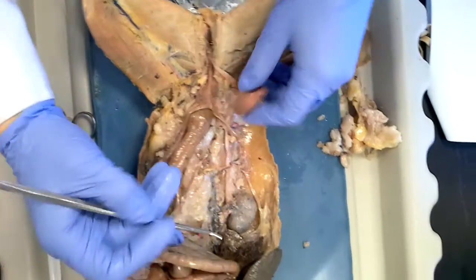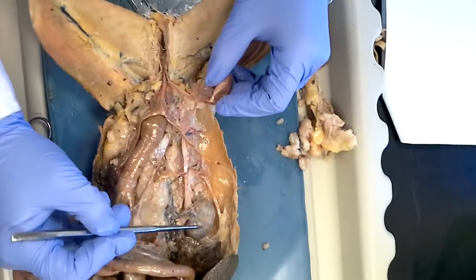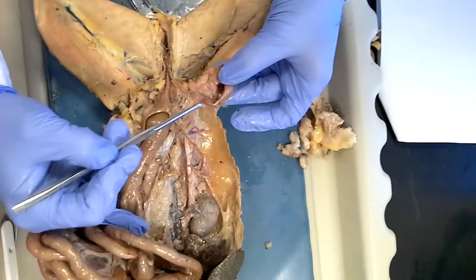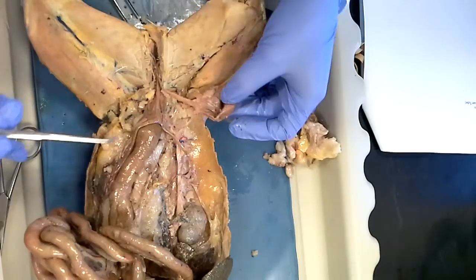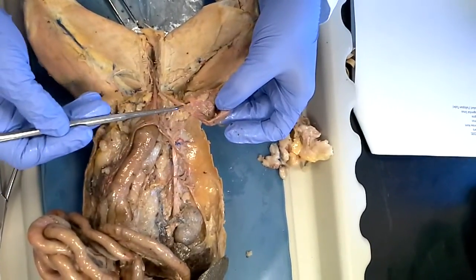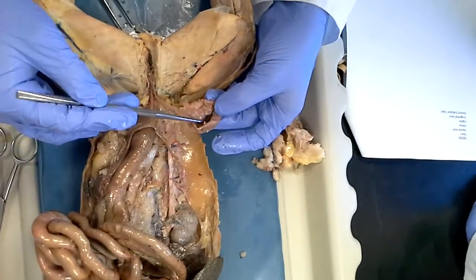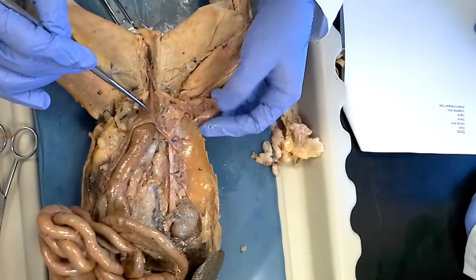The urinary system: we've got the kidney here where urine is formed, and then we have that tube, the ureter, which would connect to the urinary bladder. On the other side we have cut it so we can pull this over, but there would be two ureters connected to the urinary bladder, and then a single urethra which would take the urine to the exit. So that's the urinary bladder, and this is the urethra.